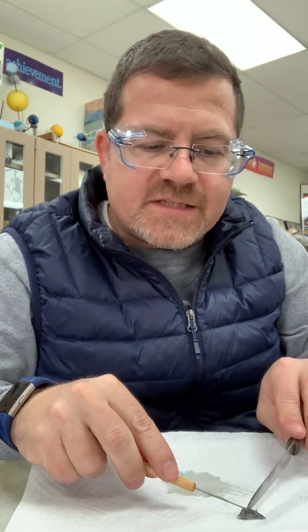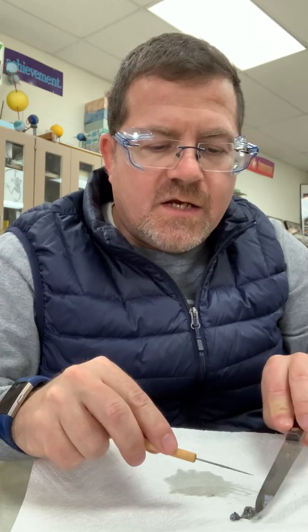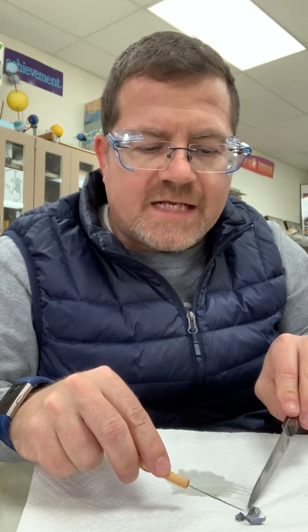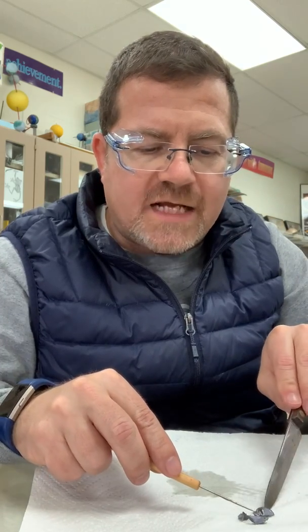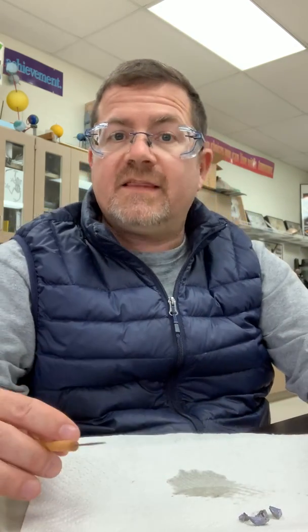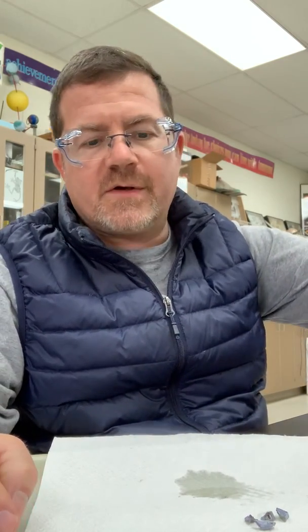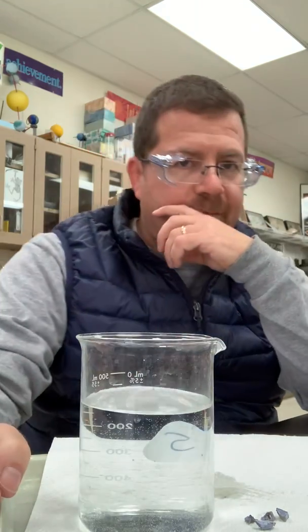If you've done what I've asked you to do, you've watched a couple of videos already on my Google Classroom page. There you got to see the way lithium reacted and the way sodium reacted. And now we're going to see how potassium reacts.